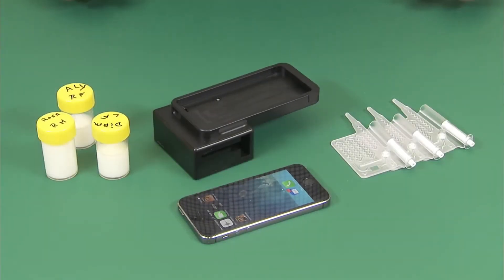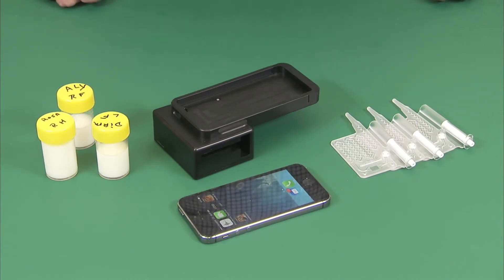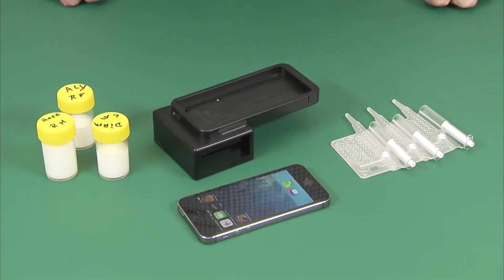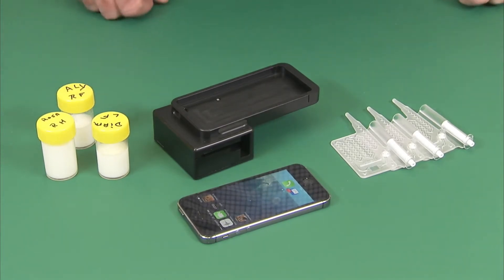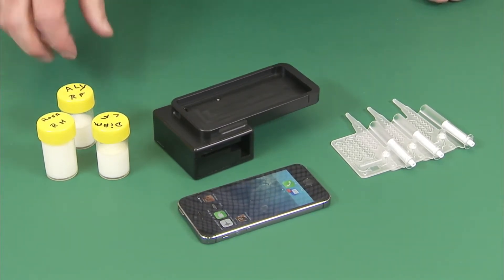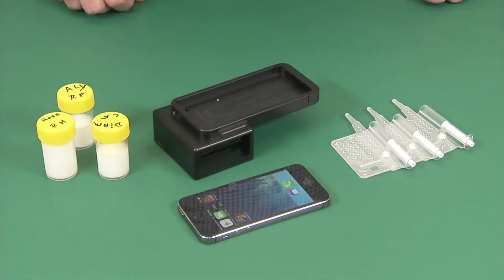Today we're going to demonstrate how to use the dairy quality device to determine the somatic cell count of any given sample of milk. As you can see, we have several samples of milk here — one is composite and these two are from individual cow quarters.